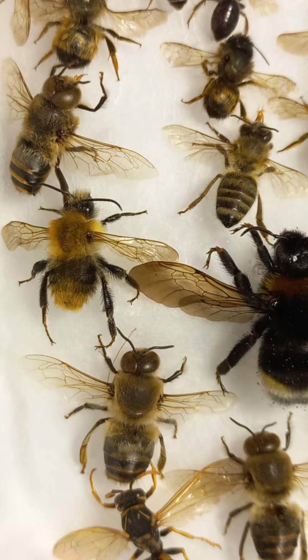The armor-plated thorax is perforated with pairs of holes called spiracles, which are part of the breathing, or respiratory, system. The first pair of spiracles, called prothoracic spiracles, are located at the site where tracheal mites can be found. But it's quite difficult because tracheal mites are very small. The second pair of spiracles are non-functional. And the last pair, although located on the thorax, is really located on the first abdominal segment. This segment is called the propodeum.